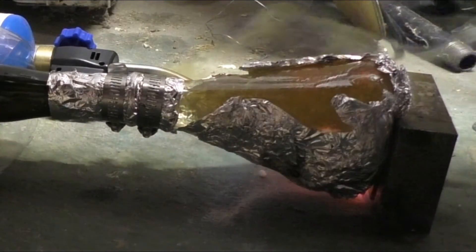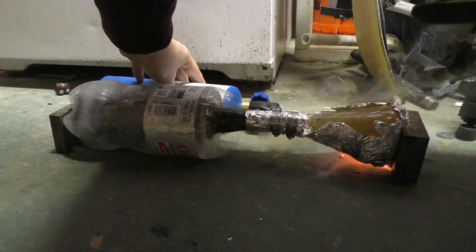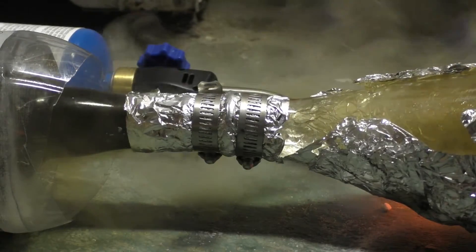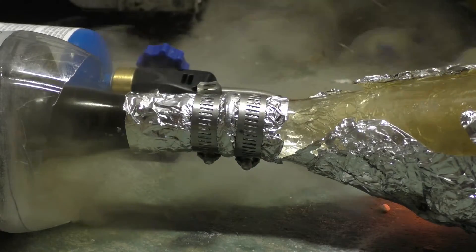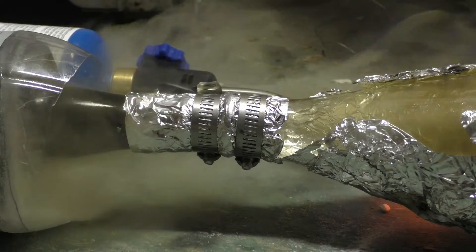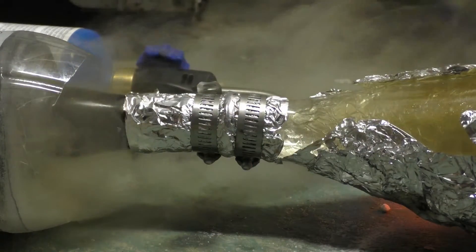I was aware this could have happened. Luckily I came prepared — I have a respirator, so don't freak out. It's alright. Most of the gases being released right now are nitrogen dioxide, nitrogen oxide — nitrogen products — probably some nitric acid even in vapor form. It's not that bad, stuff just happens.